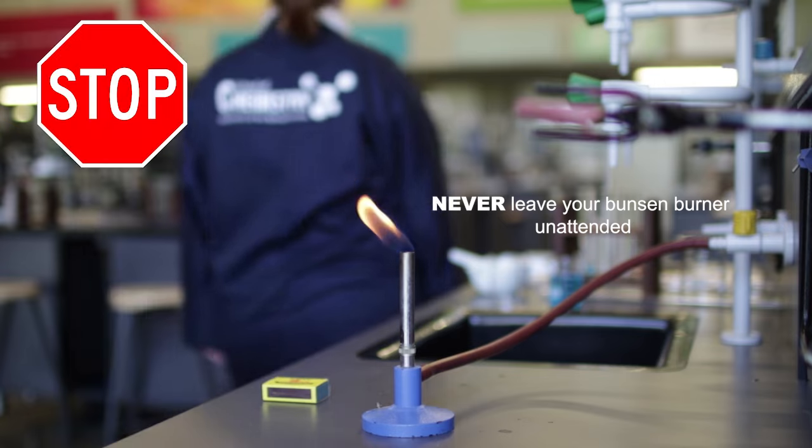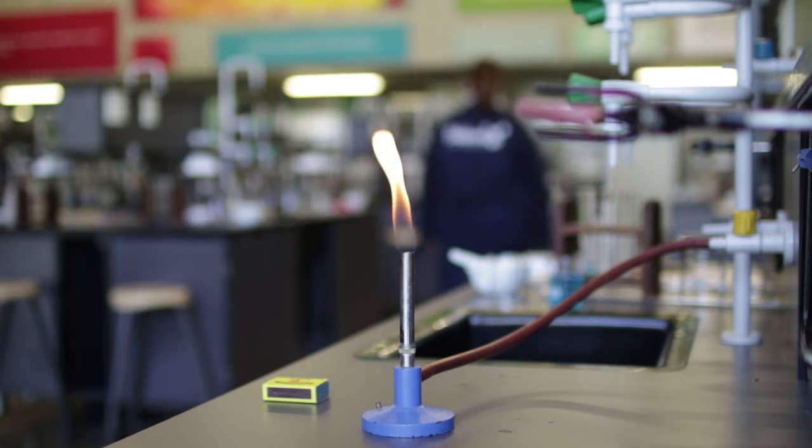Never leave your Bunsen burner unattended. You should always close the gas tap whenever you leave your bench.